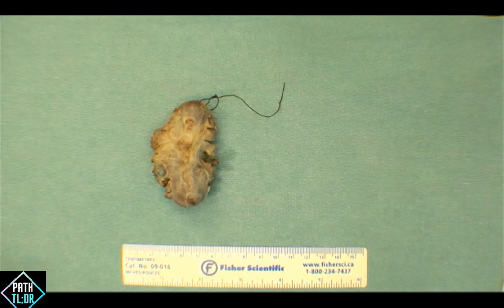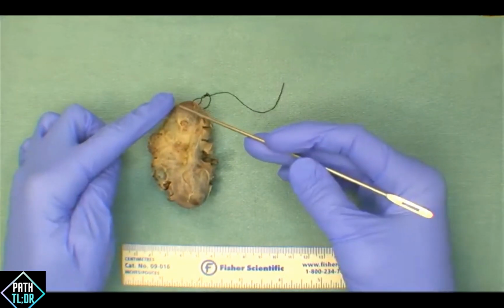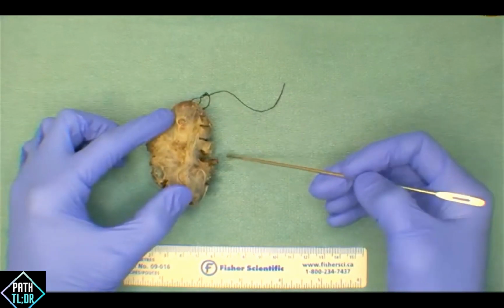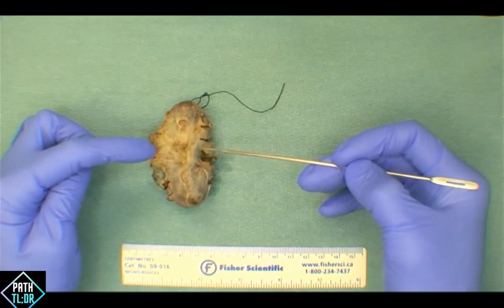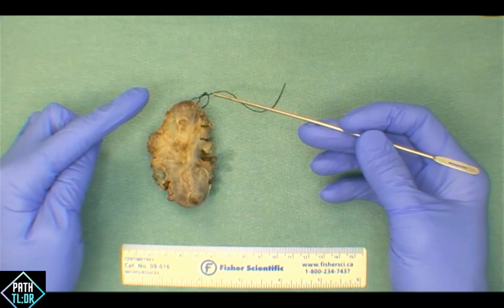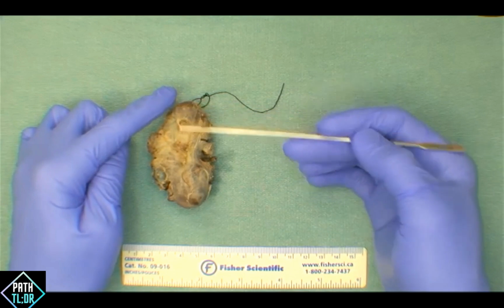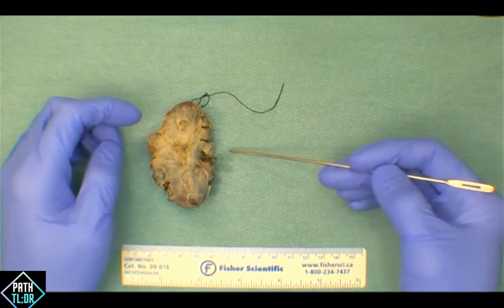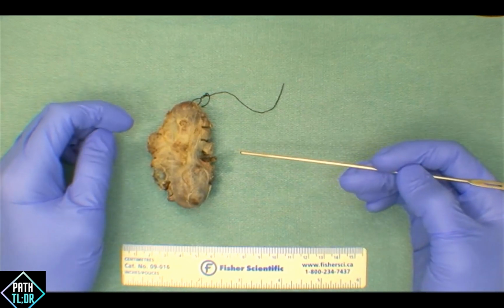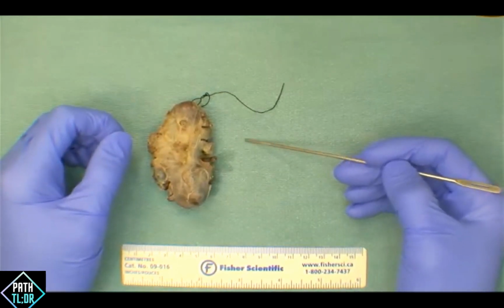So yeah, there's two lobes, the right and the left, connected via the isthmus, which sits transversely across the trachea. The superior aspect of each lobe comes to a slight point and extends more superior from the isthmus. If you can imagine, the isthmus would be right down here. You would have the superior part of each of the right and the left lobe extending a little bit more superiorly. The superior tip extends up to the level of the thyroid cartilage on the larynx, and then inferiorly sits around the cricoid cartilage. Occasionally, sitting on top of the isthmus, you can have a pyramidal lobe, and it's a normal kind of anatomic variant, and it's this triangular shaped accessory lobe of the thyroid.